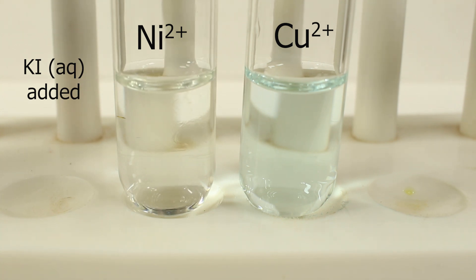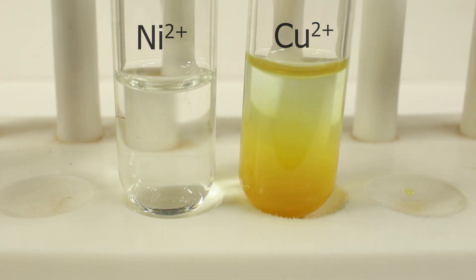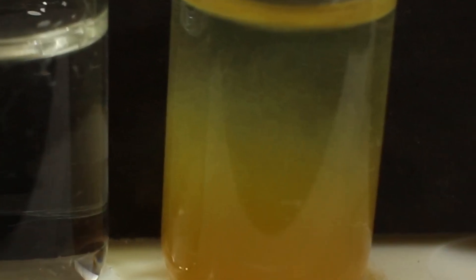In case of copper II brown color is formed. It's appearance of molecular iodine. Iodide ions are oxidized to iodine. And another thing, white precipitate.